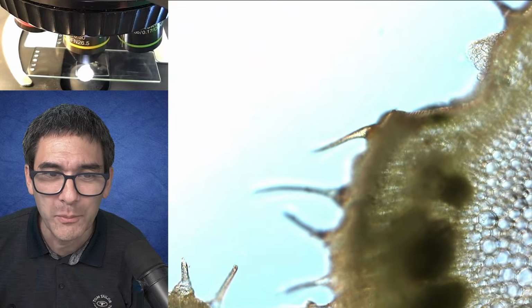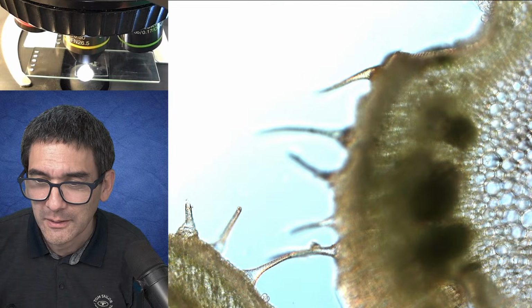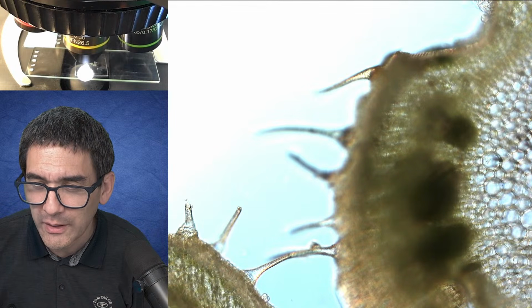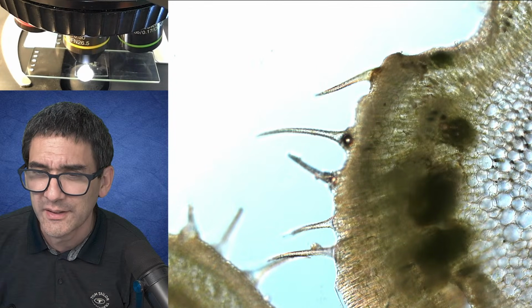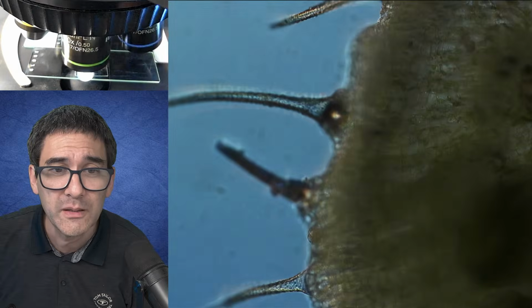Yeah, of course, making now a permanent slide of this would be quite nice, huh? Yeah, the quartz crystal on the microtome will vibrate and cut better. That's actually kind of my idea, some kind of a quartz or piezo quartz or something like this. So this is something that is worth trying.